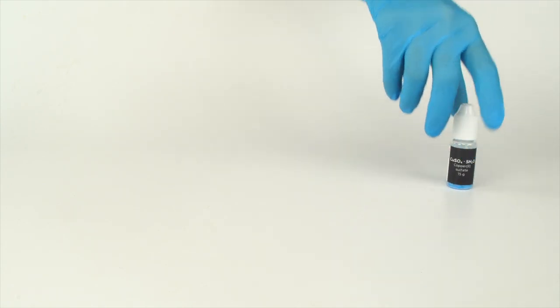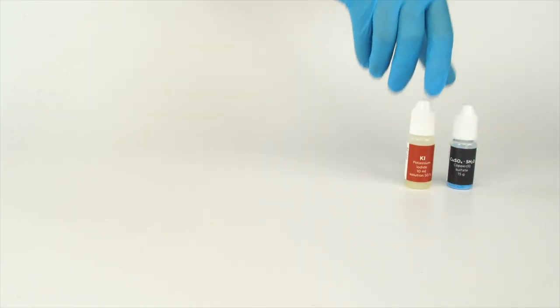For the iodine diffusion experiment, you will need copper sulfate, potassium iodide solution, and disodium disulfite solution.